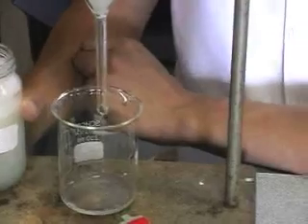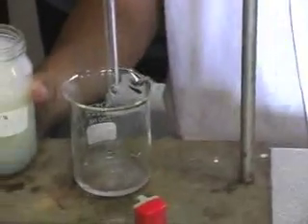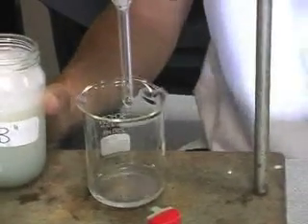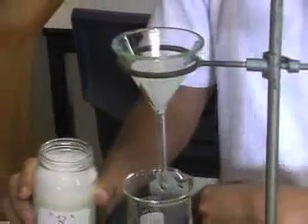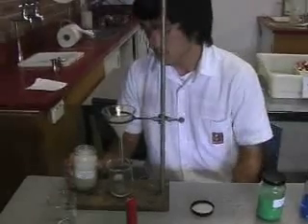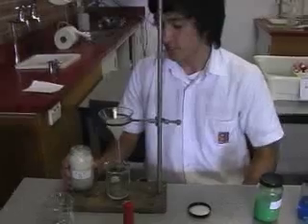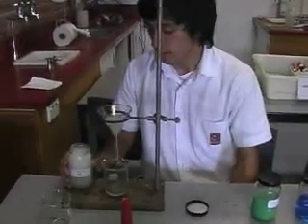Something's blocking it up. What does the liquid look like that's going through? The liquid still in the filter paper is more of a greenish colour, and when it's coming through it's quite clear. So what would that indicate? The filter paper is filtering something out — more than likely the oil that's in it. Right, and possibly the detergent, which is the little bit of colour that's in there.